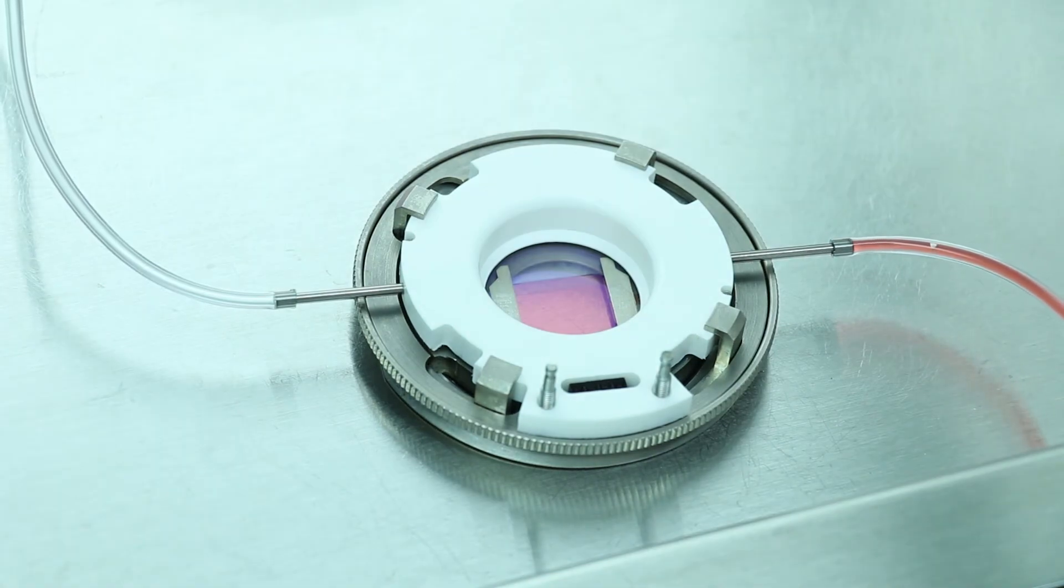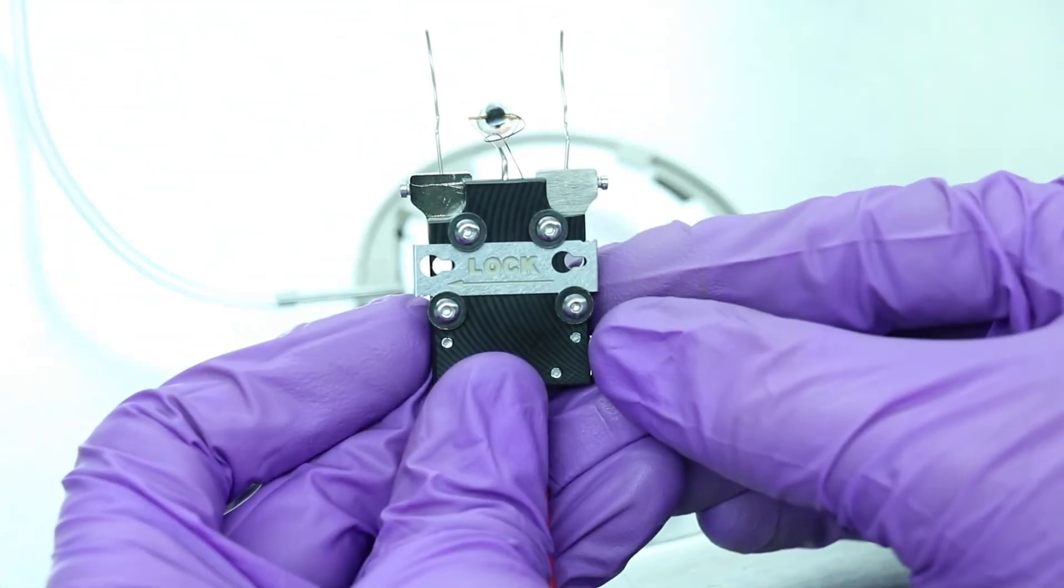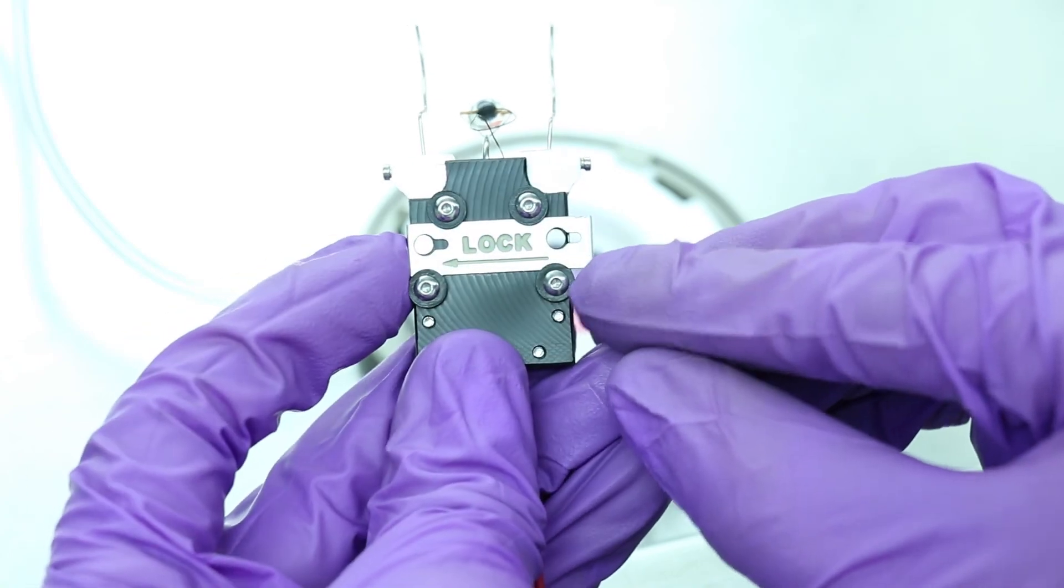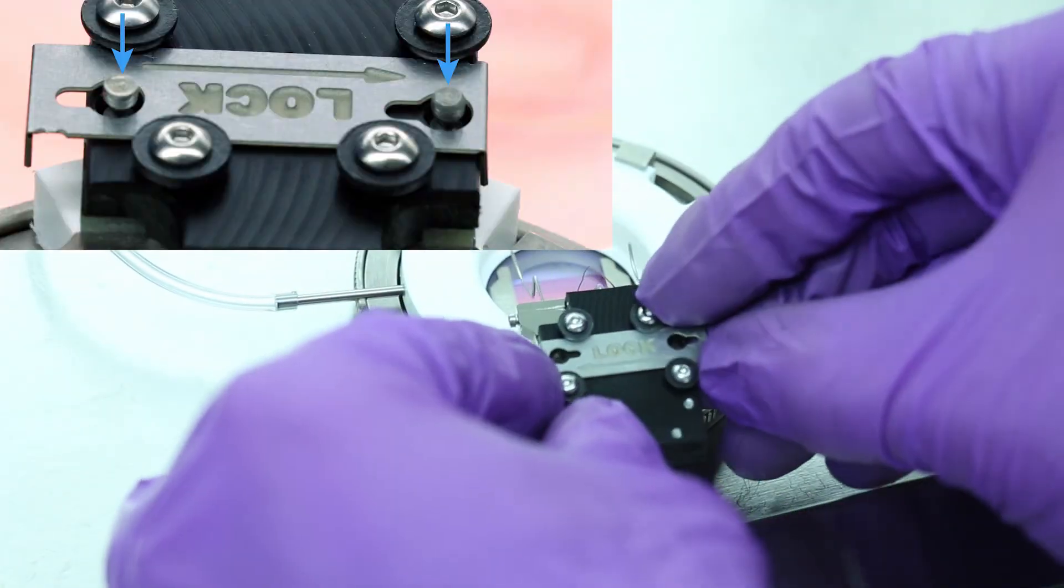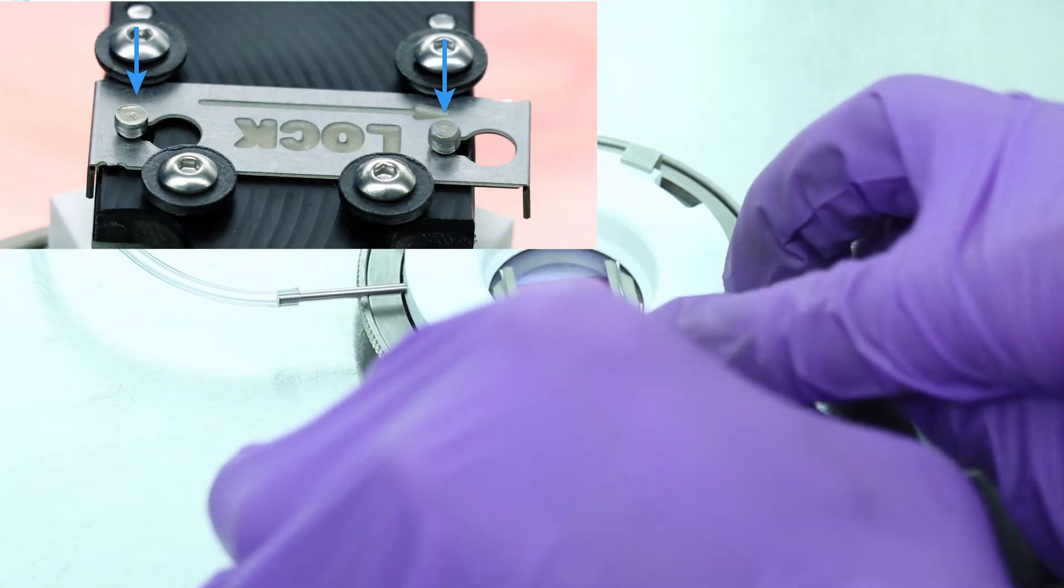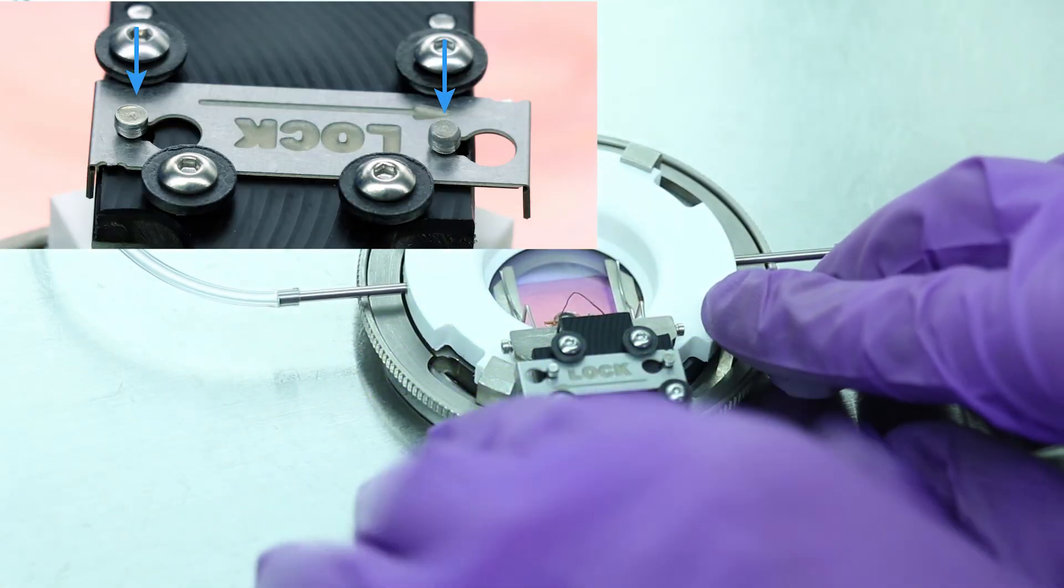Open the lock on the electrical connector by sliding it so the lock is fully open exposing the holes. Place the connector over the mating posts on the white top, then slide the locking tab with arrow to secure the connector on the FCS2 chamber.